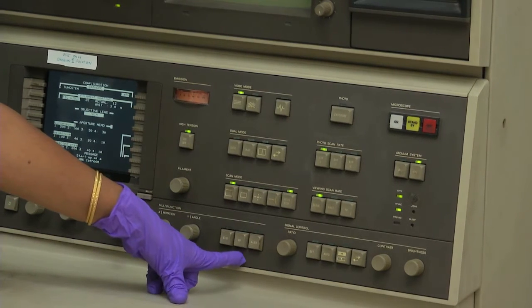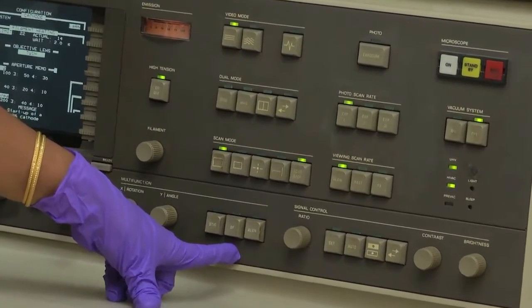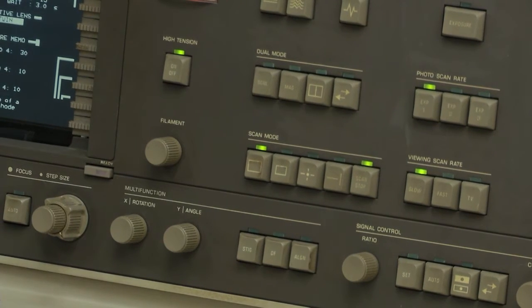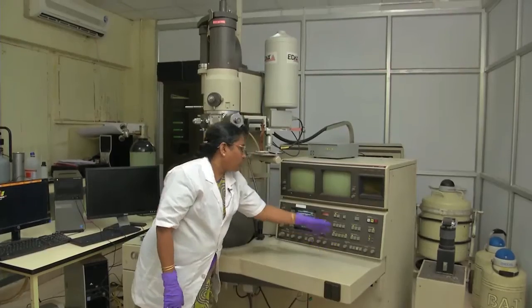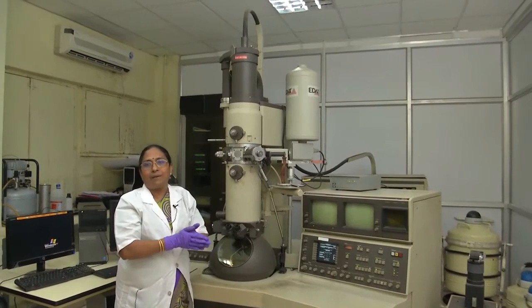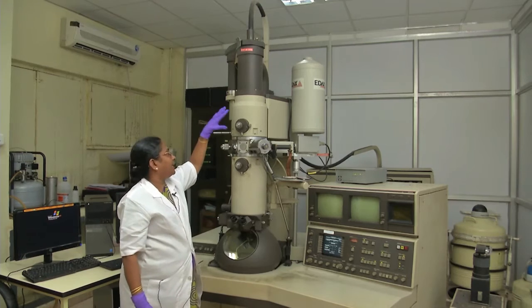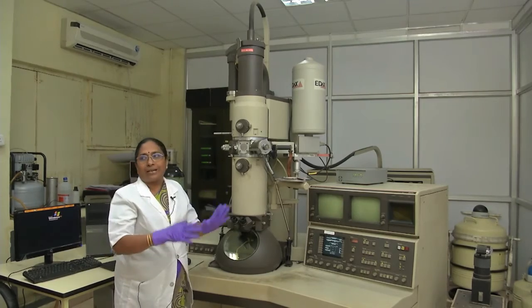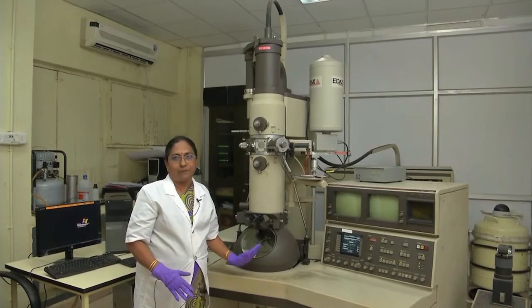This is the dark field image button — I will show you in the monitor how the dark field image appears. By pressing this you can tilt the gun slightly toward the diffracted beam. This is the alignment control. Because you have a very linear column, you must align the beam. Different alignment procedures are used starting with the gun, then the column, adjusting current through all lenses to ensure the beam properly hits your specimen.